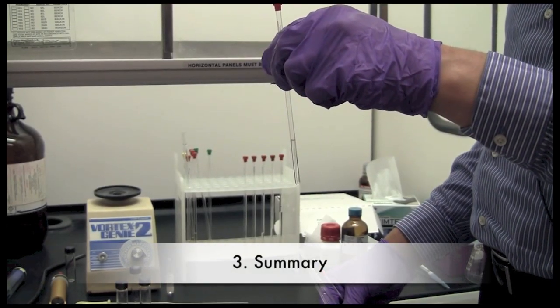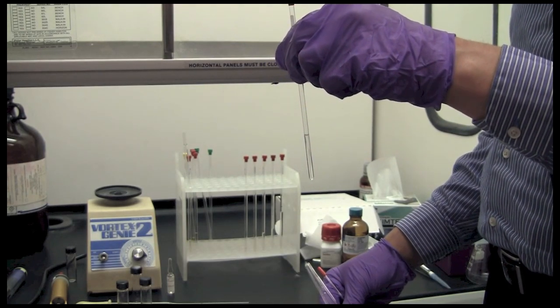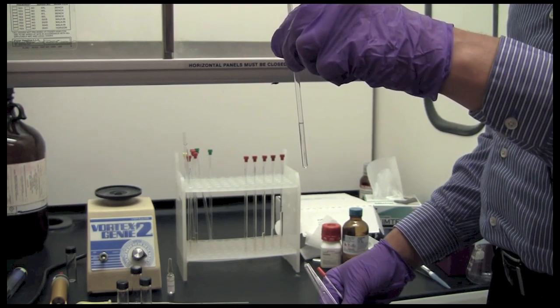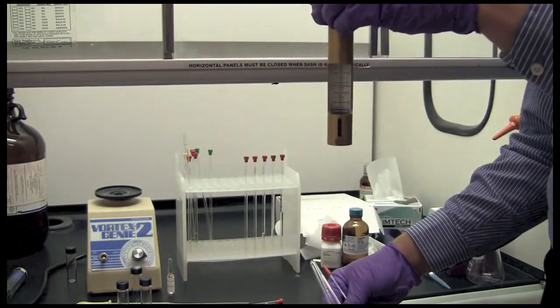To recap you should prepare your sample for NMR in a high quality NMR tube with about 0.6 milliliters of deuterated solvent. Resulting samples should be a homogeneous liquid and placed properly within the NMR sample depth gauge.